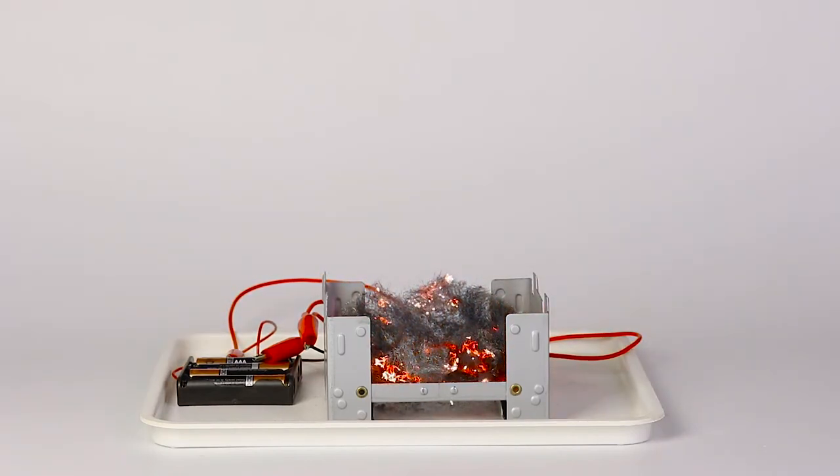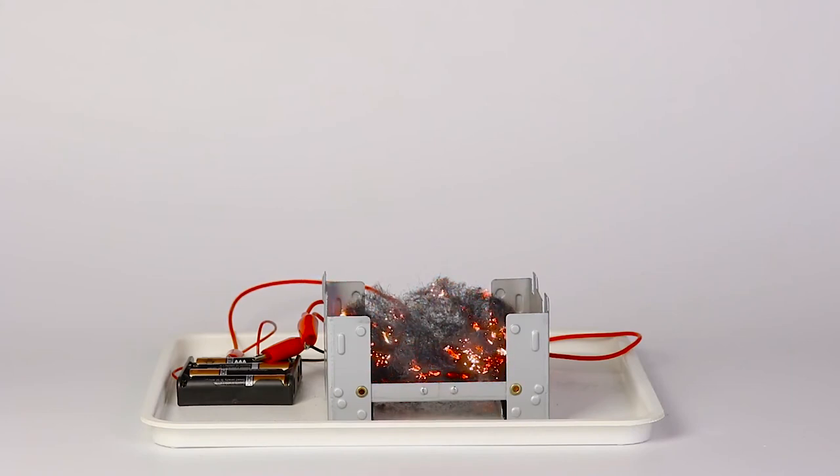Iron wool heats up so dramatically when electric current passes through it that this heat is enough to set the wool on fire.